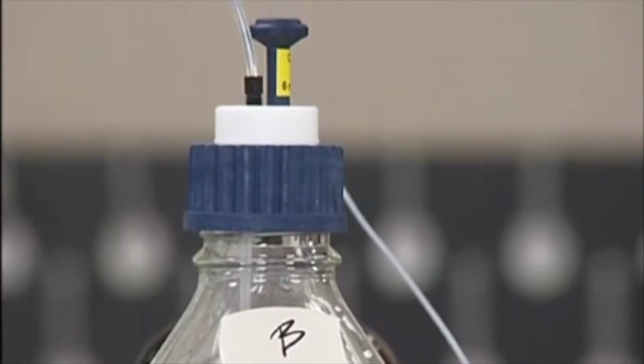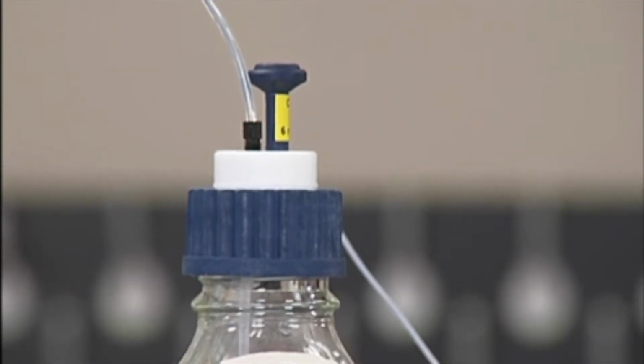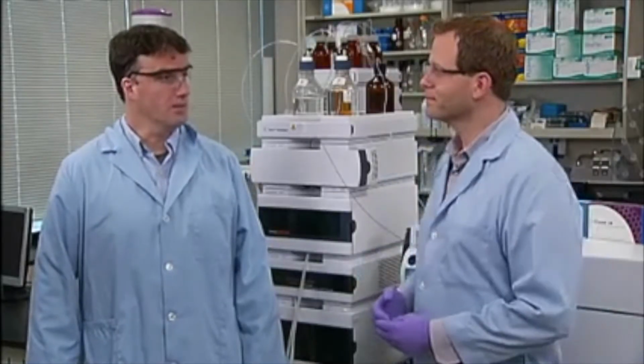Yes, it is, Rory. Now, before we move on, I'd like to point something out. As more and more chromatographers are working with noxious or volatile solvents, safety in the lab is an important concern. These bottles are fitted with Agilent solvent safety caps, which prevent leakage of solvent vapors into the air and improve lab safety. They also reduce evaporation of volatile solvents, reducing problems with retention shifts that may occur when solvent or modifier concentrations change due to evaporation. And anything that preserves solvent use saves money too.